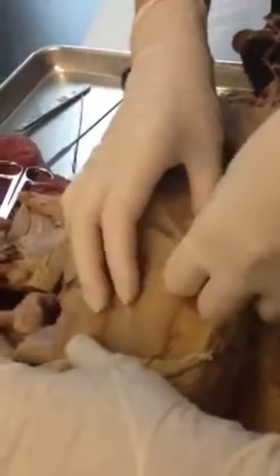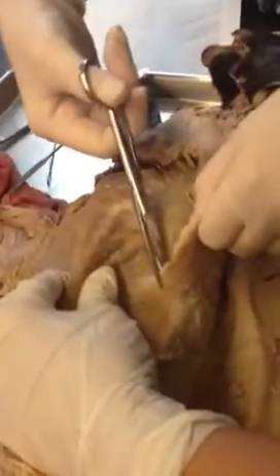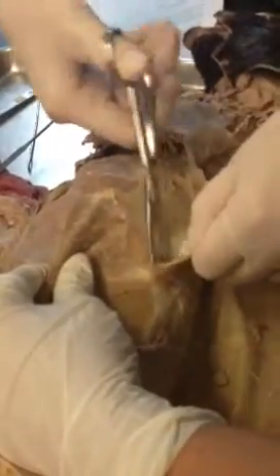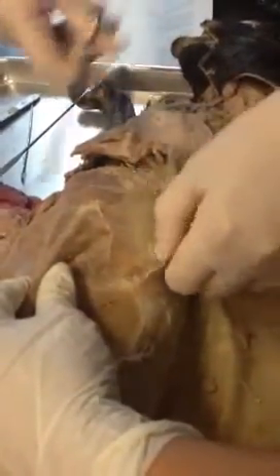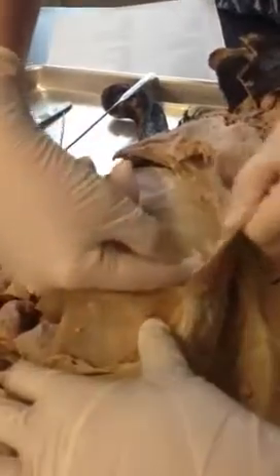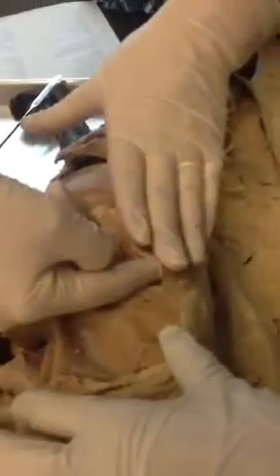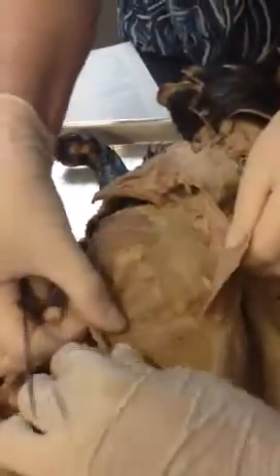So all of this is our latissimus dorsi. See, it's starting here and moving cranioventrally, and it is superficial. Your external abdominal oblique is starting just about the same place. So there's just a tiny little area there where they're overlapping. Or the latissimus dorsi is overlapping your external abdominal oblique.